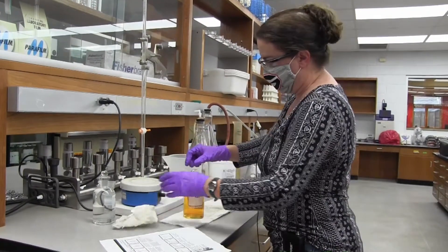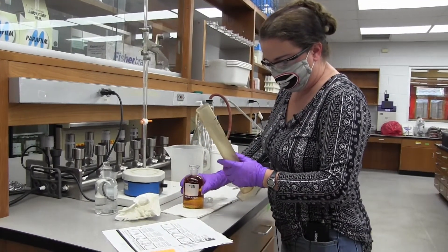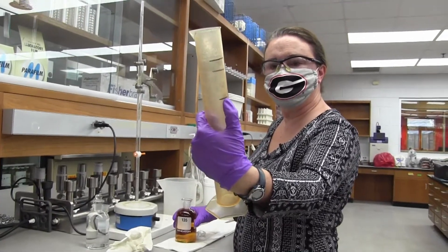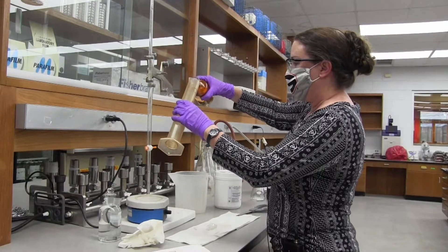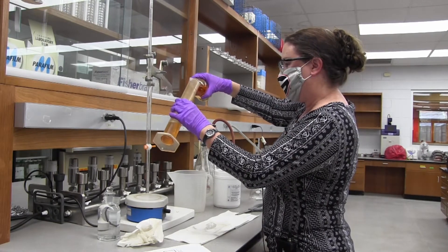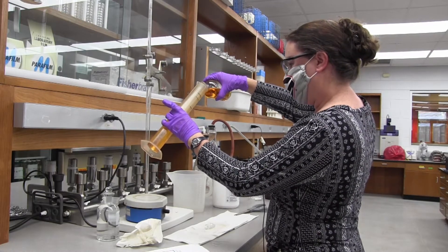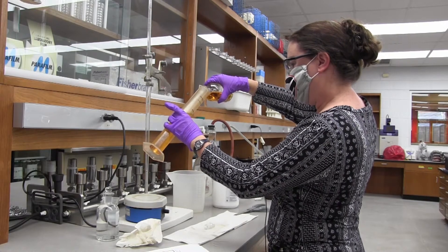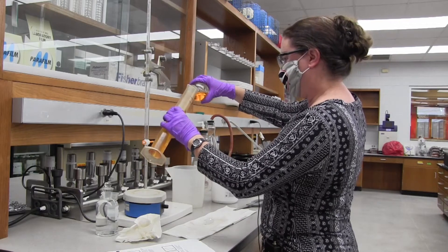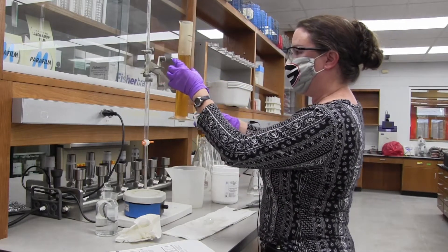Take the paper towel off. Now we're going to pour the contents in a 250 ml graduated cylinder to the 200 ml mark. I'm also going to pour this the same way down the side trying to prevent any air bubbles.